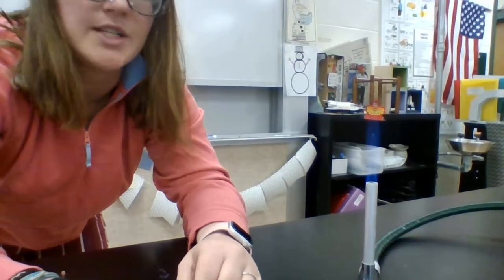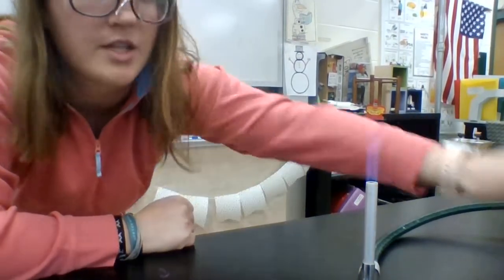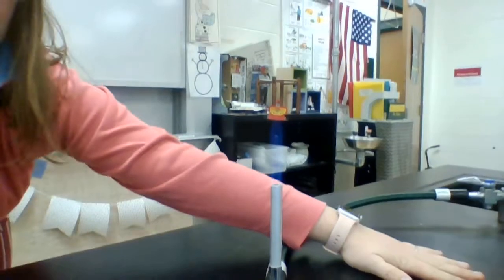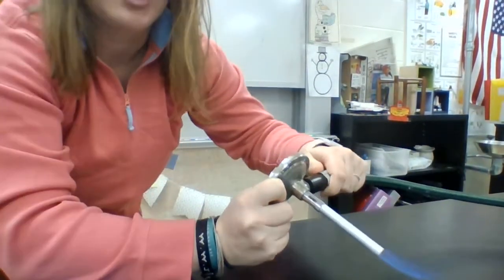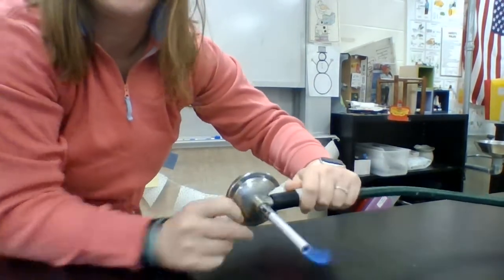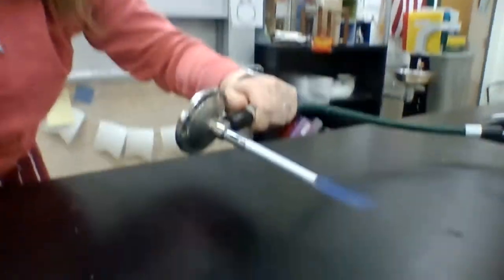So with that being said, I'm going to show you that water forms. You guys know from working at our lab stations that if you have sweaty hands, they leave prints on the table because they are wet. What we're going to do is take this Bunsen burner and actually put it directly on the table. Let's get it at an angle you can see it.